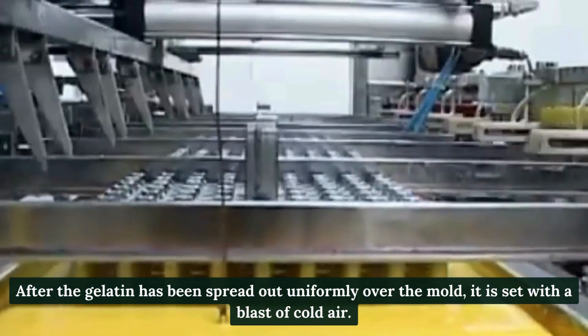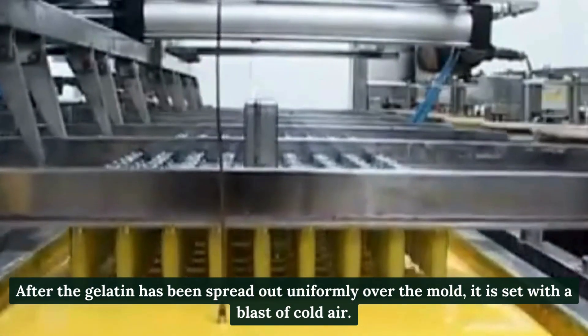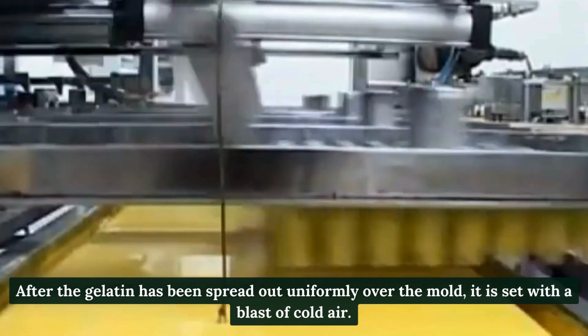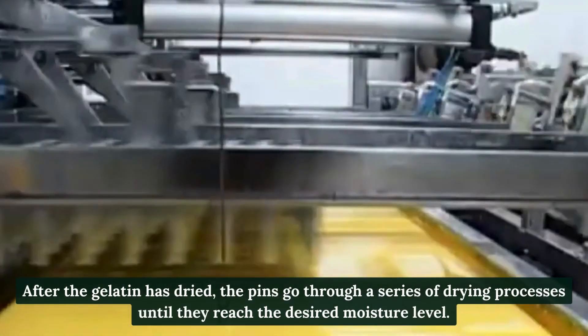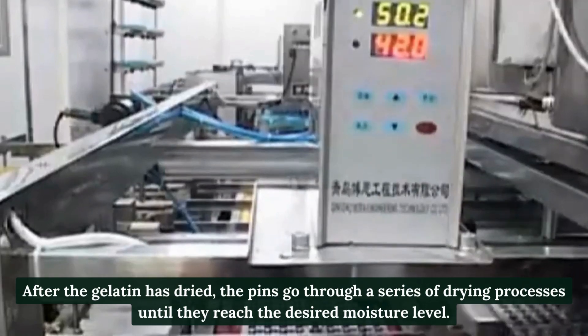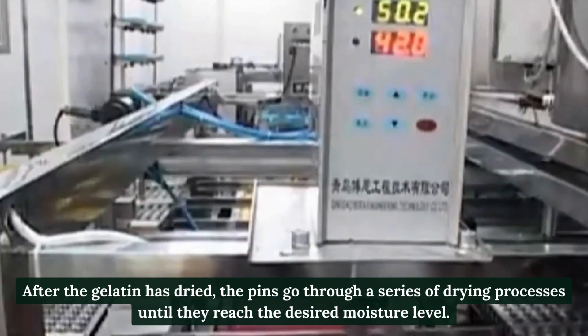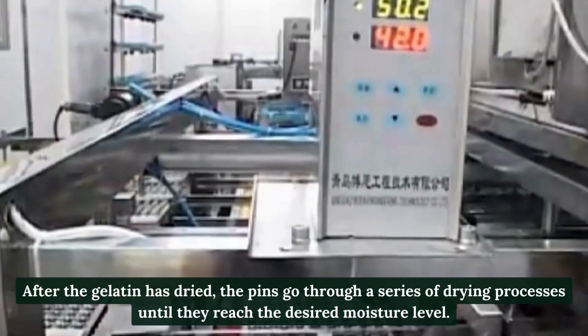Step 4: Dehydration of the gelatin-covered pins. After the gelatin has been spread out uniformly over the mold, it is set with a blast of cold air. The pins then go through a series of drying processes until they reach the desired moisture level.